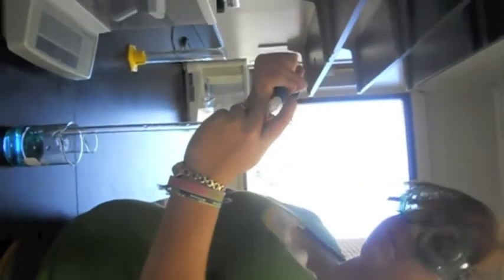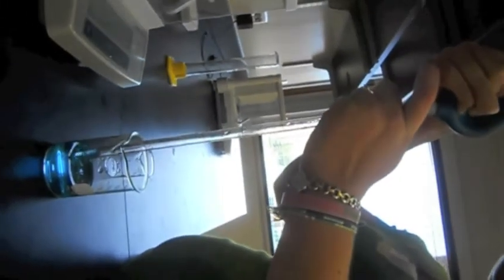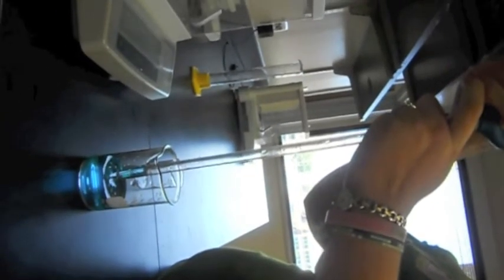Using your dominant hand, you need to squeeze the ball firmly, place this on the top so you don't let air in. Put the pipette into the water, not touching the bottom, but deep enough that it can let the water come in.